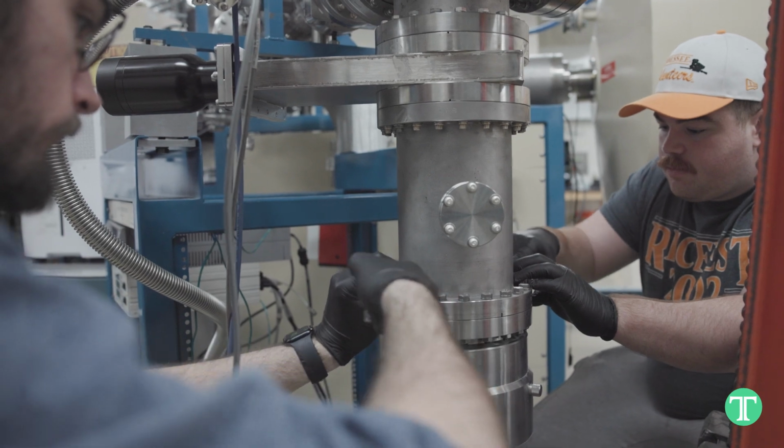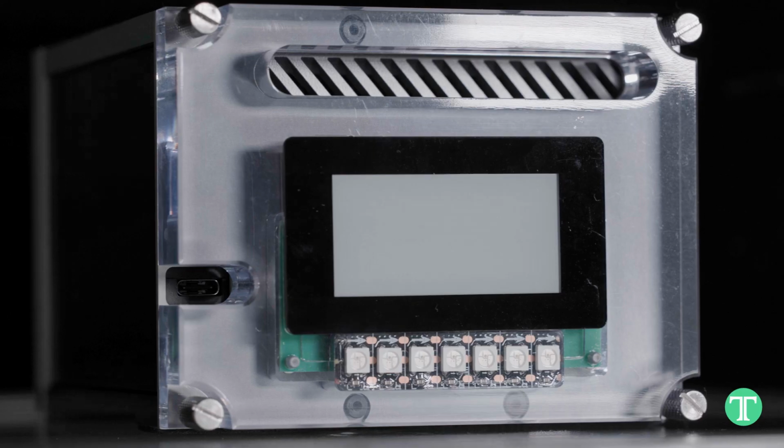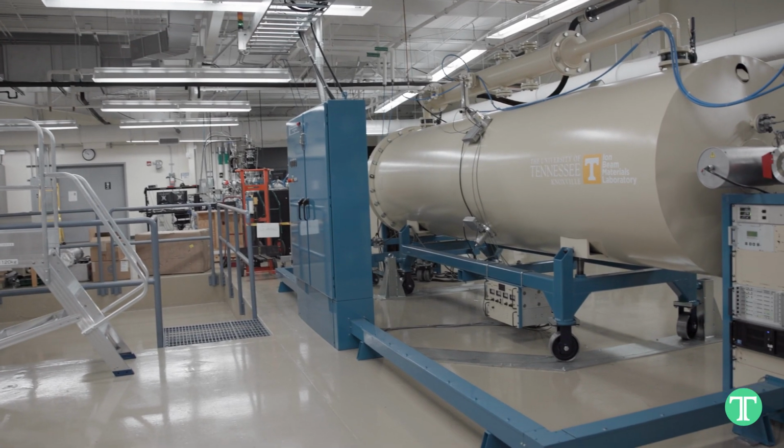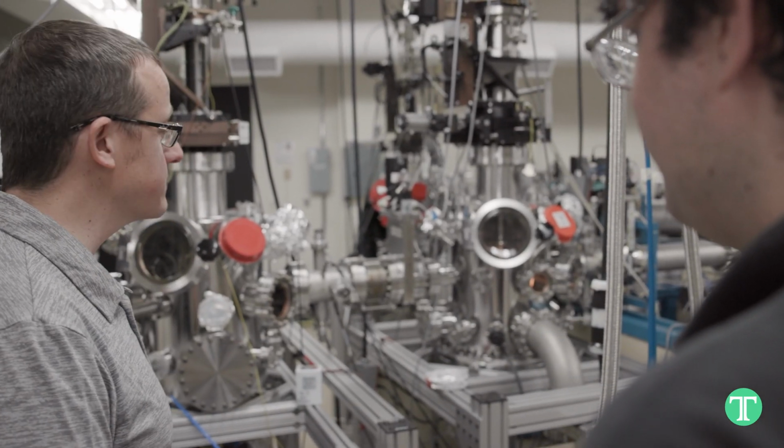Theia Scientific is great. As soon as our microscope was on, one of the first additions we did to our microscope was the Theia Scientific system. It's really easy to use, really simple. It was really fast to incorporate it in. The machine learning aspect of it really speeds up the tedious aspects of the work so that we can focus on the real science aspects of it.